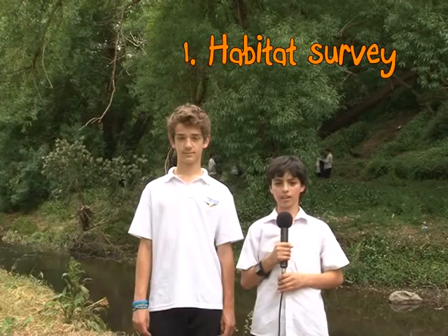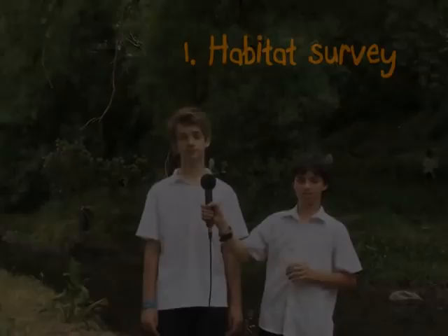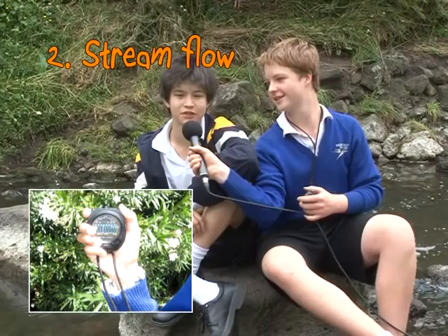We start by surveying a habitat to identify its condition and local plants, and then we start the physical tests. Pollution can have more of an effect when water levels are low. High water flows can bring pollution from upstream.